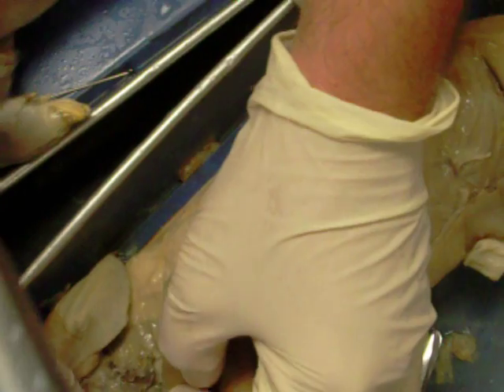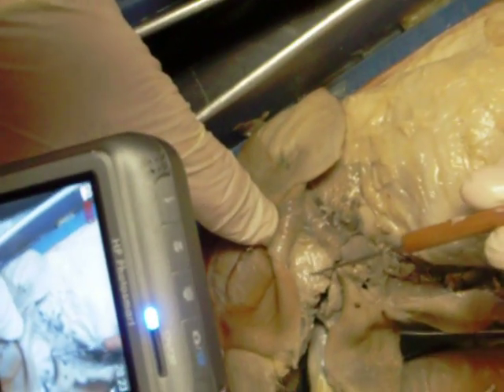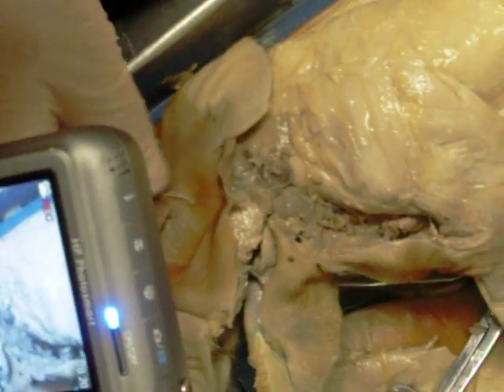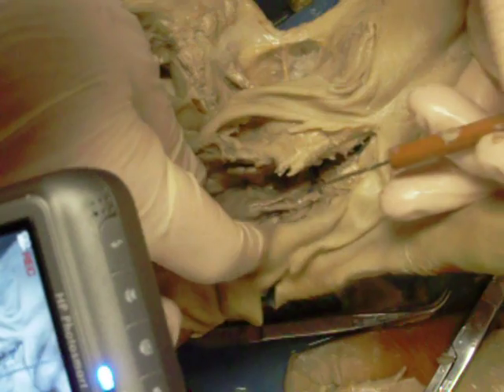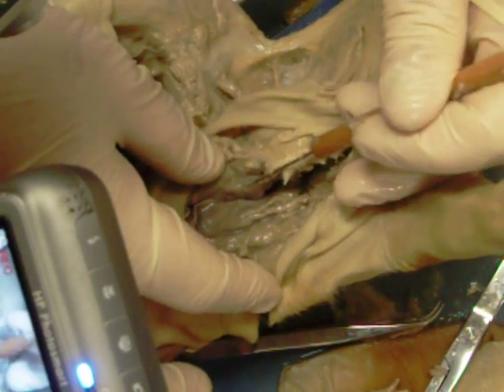Going back anteriorly, examining the head. Here we have the masseter muscle and the parotid gland. Looking at a couple more glands, we have the thymus gland. It's multi-lobed and found on both sides — there it is there.